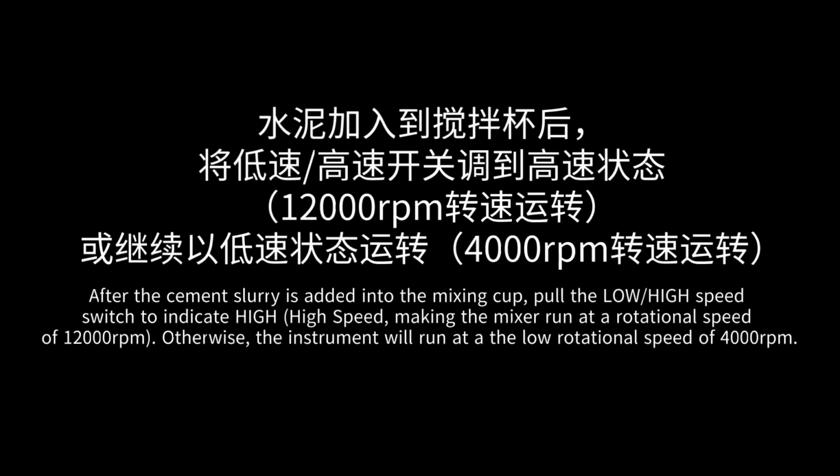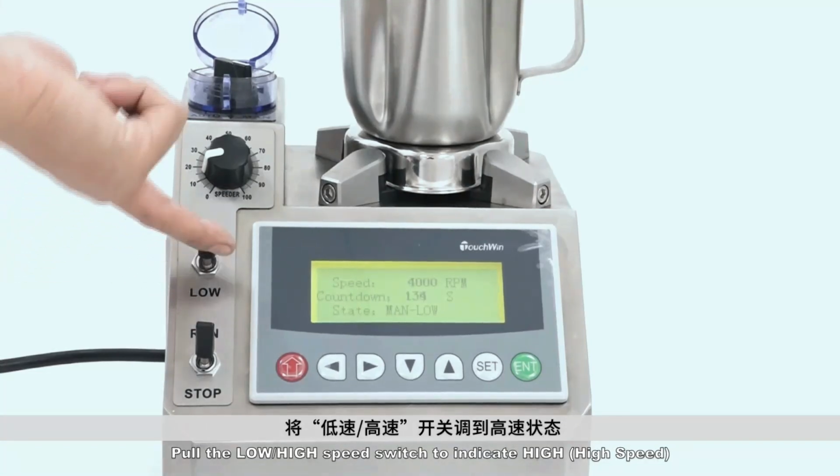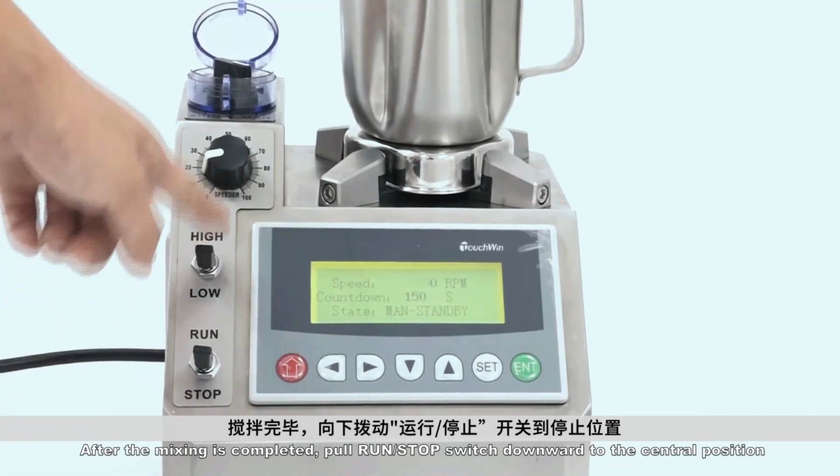After the cement slurry is added into the mixing cup, pull the low-high speed switch to indicate high. Otherwise, the instrument will run at the low rotational speed of 4,000 revolutions per minute. Pull the low-high speed switch to indicate high speed. After the mixing is completed, pull run stop switch downward to the central position.